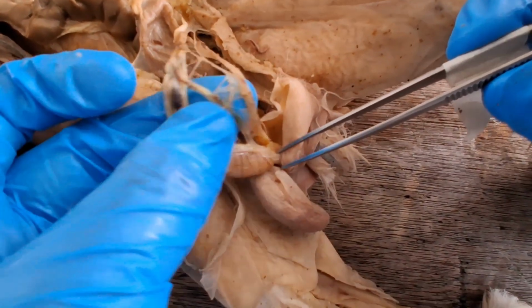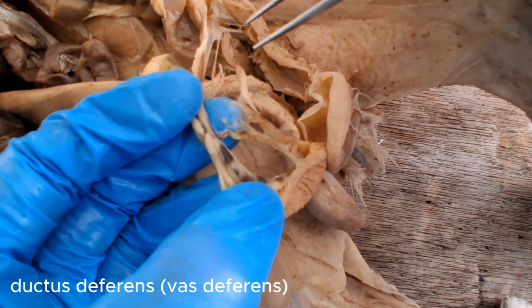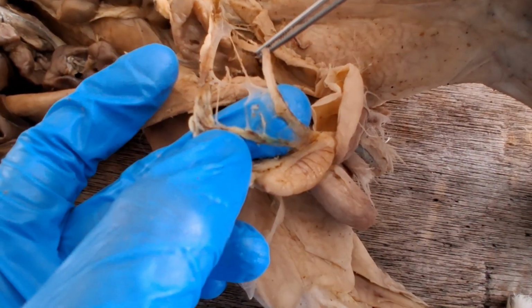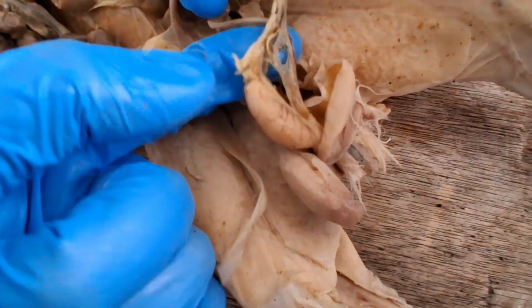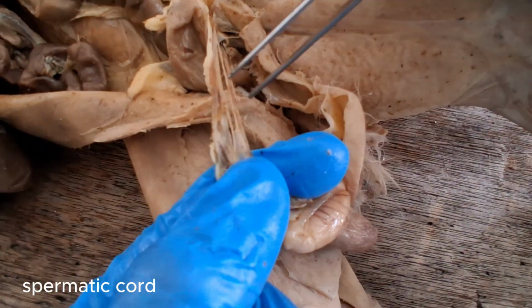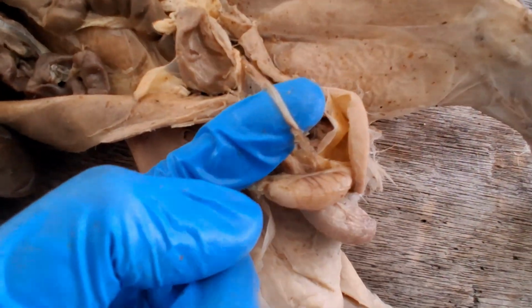Then the sperm, upon ejaculation, will travel via the ductus deferens or vas deferens. In life, the vas deferens is associated with other blood vessels and nerves, servicing the testes, and together they comprise the spermatic cord. I already dissociated the ductus deferens from the rest.